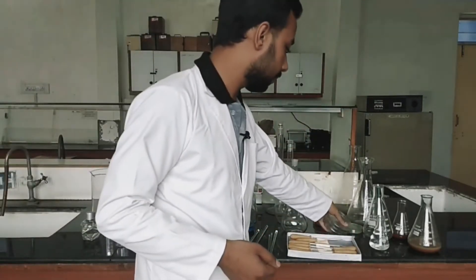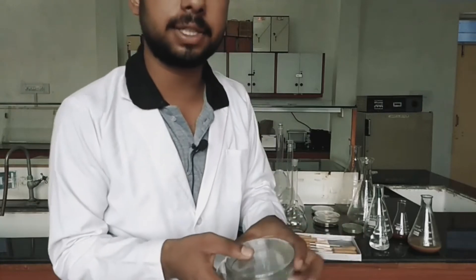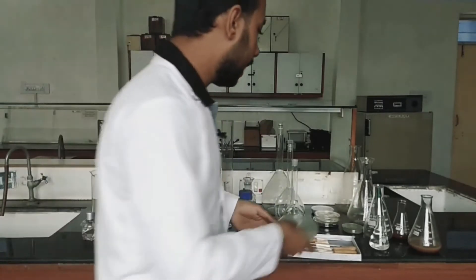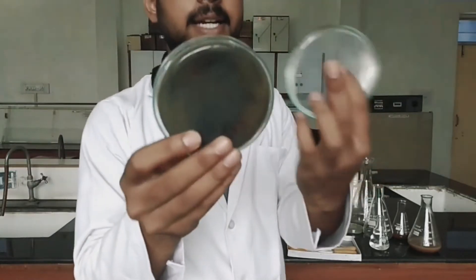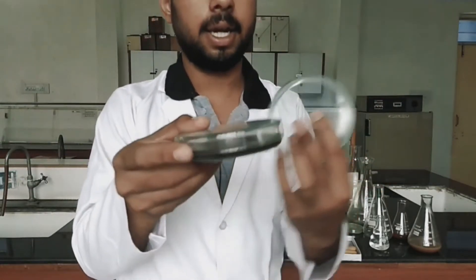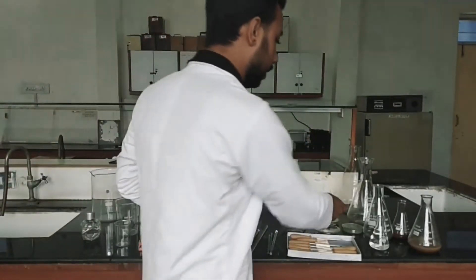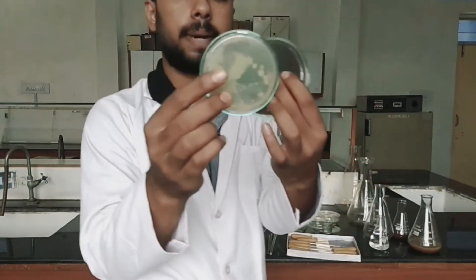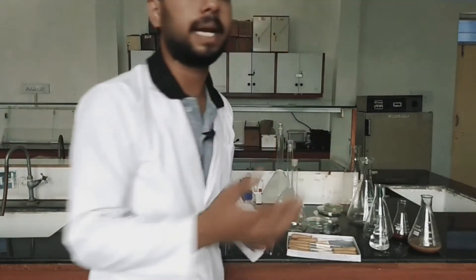Next one is the petri plates or culture plates. These are used for the solidification of culture media and the growth of bacteria or microorganisms on them. This is a blank petri plate, and this is a filled petri plate which has culture media in it on which bacteria is growing. They are also available in different sizes — this is the small petri plate and this is the large petri plate.